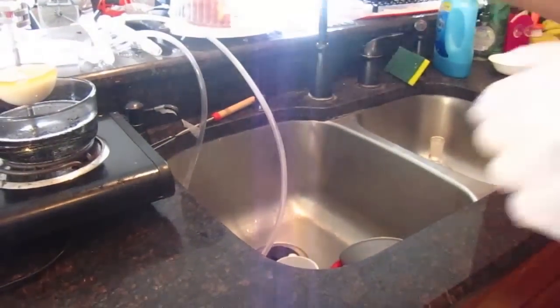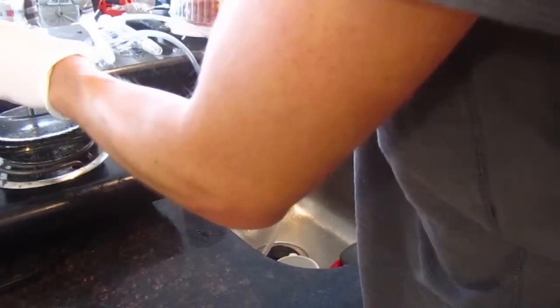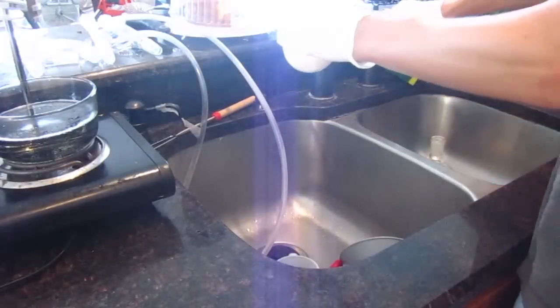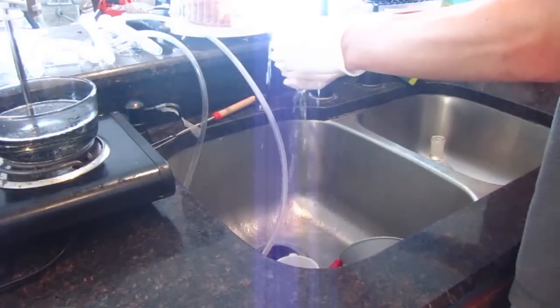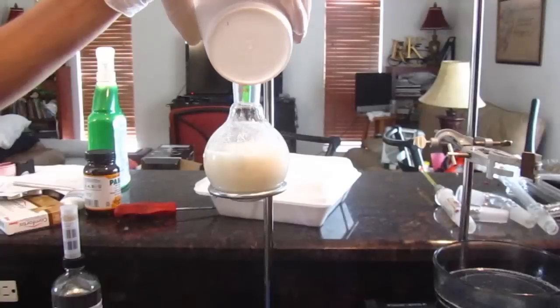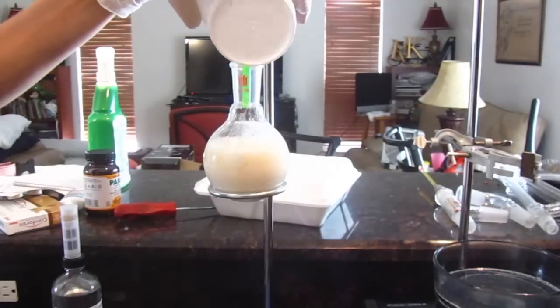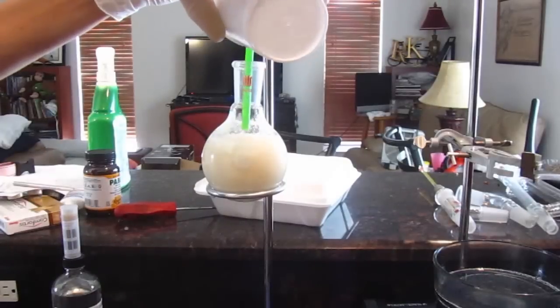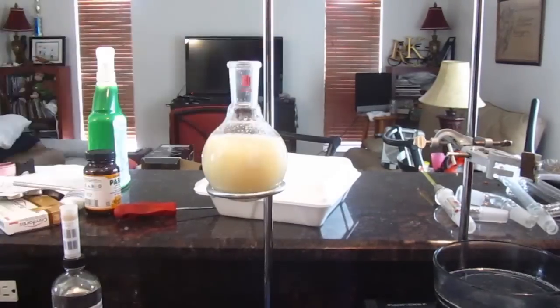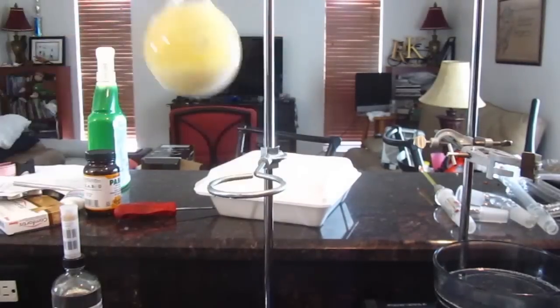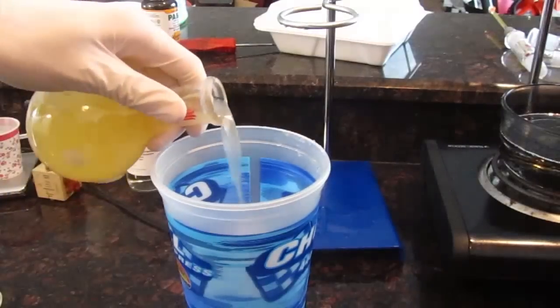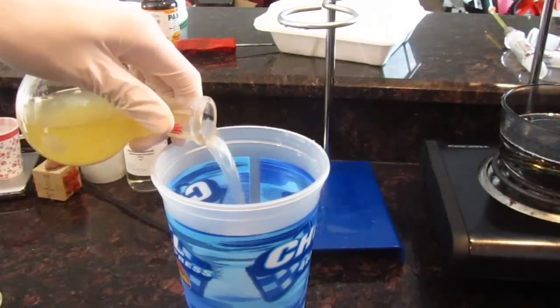Now, this is an equilibrium reaction, meaning that your ester will easily turn back into an alcohol and your acid. So we want to cool this and do this next step as fast as possible. What I'm doing here is we need to get rid of the acid in the solution, all that sulfuric acid. That means six milliliters of sulfuric acid took a lot of sodium carbonate.